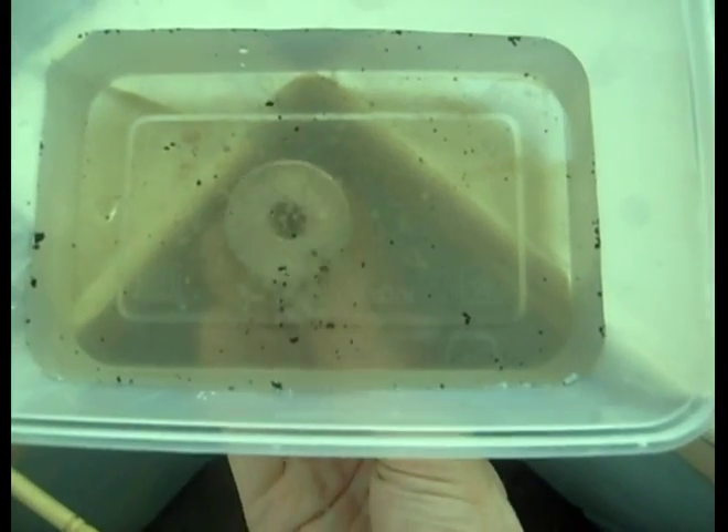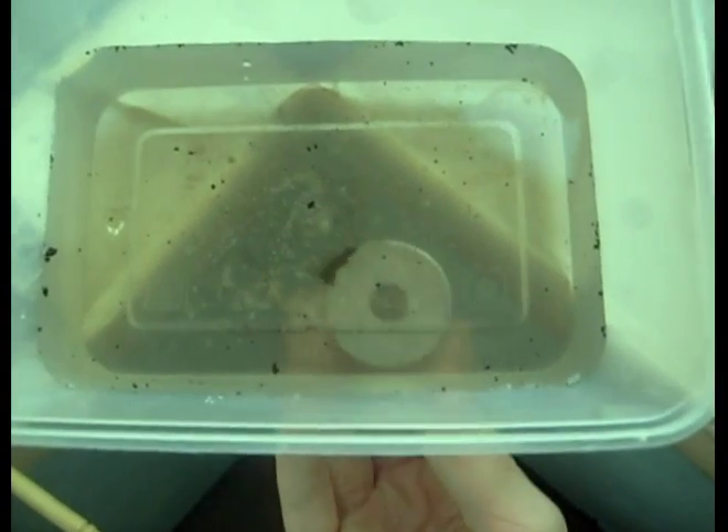Here's another look at what we got with a thinner dish — these things are very ferromagnetic, so we got something here. I'm hoping it is iron 2 oxide. After I dry it out, I end up with this black powdery stuff. Let's dump it on the table and use a magnet — as you can see, it reacts. It doesn't react extremely strongly and it kind of jumps around. That's probably because it's an odd-shaped particle with all the carbons, so when it tries to pull it, it kind of bounces. I'm not entirely sure it's iron 2 oxide — it could be some kind of iron acetate that is ferromagnetic — but I think it's iron 2 oxide mixed with some carbon compounds. It appears that we can make ferromagnetic particles out of vinegar and iron 3 oxide.